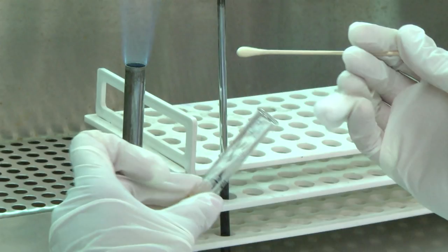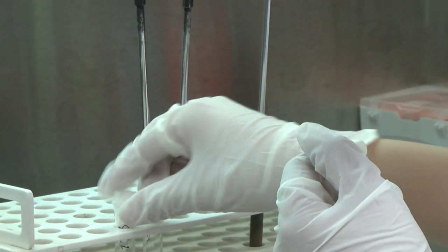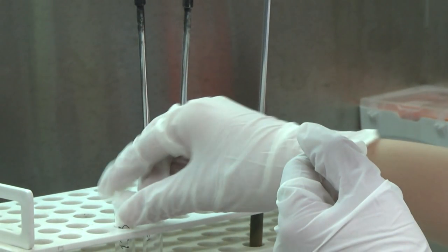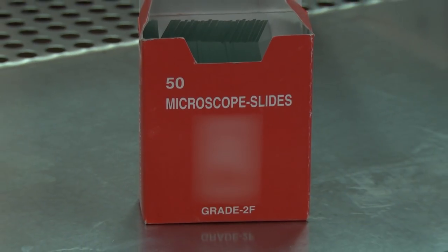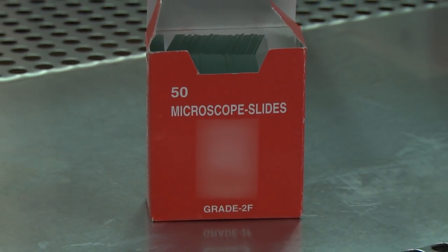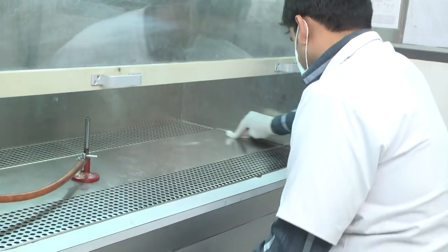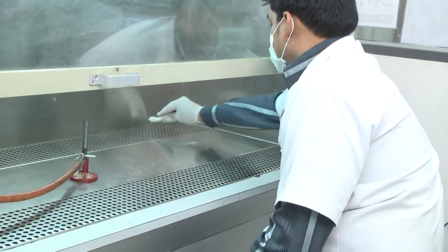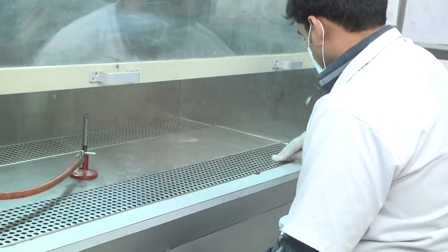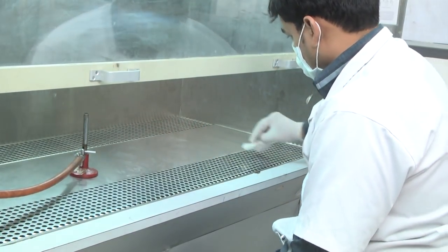This can be avoided by holding the top or cap in the hand. Always use racks to hold tubes and bottles containing specimens or culture media. Make smear preparations from specimens after inoculating the culture media. Decontaminate the workbench before starting the day's work and after finishing. Use a safety cabinet when working with hazardous pathogens.